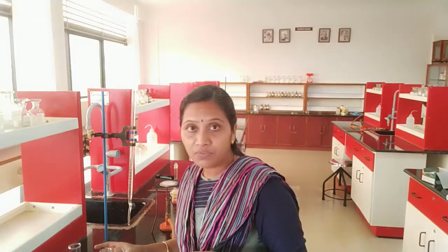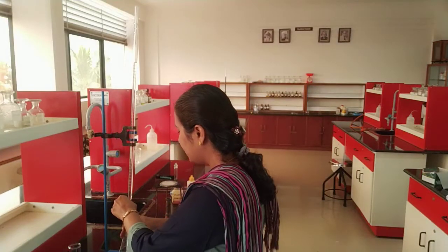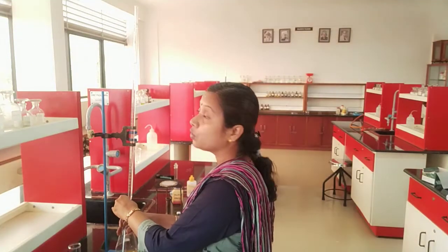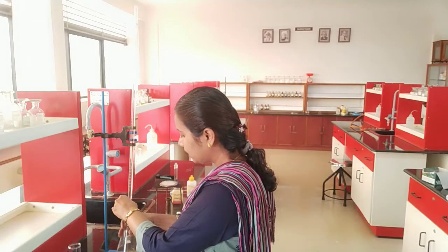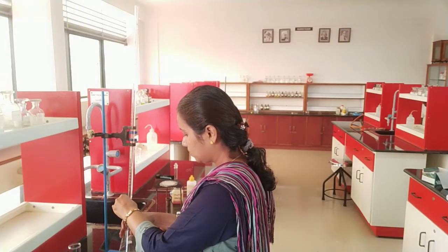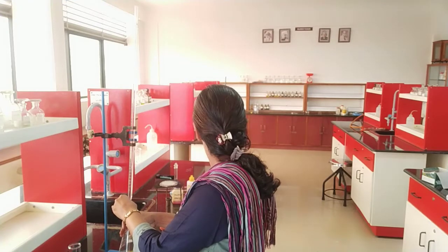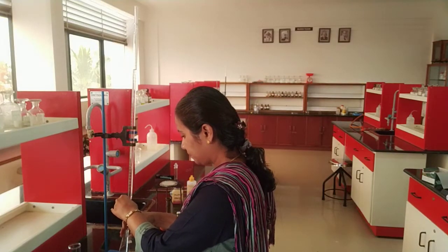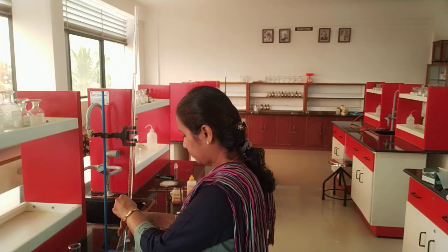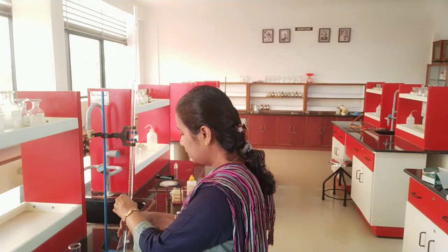So I am just going to proceed with my experiment. The end point here is the appearance of pale permanent pink colour. The left hand side should be opening the stopper and the right hand side I am reading. I have noted the initial reading as 9, so I am proceeding with my experiment.